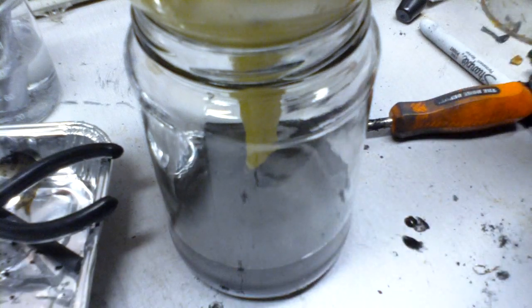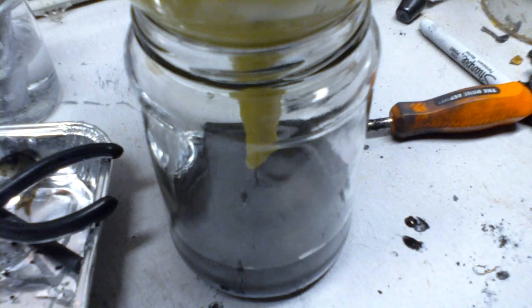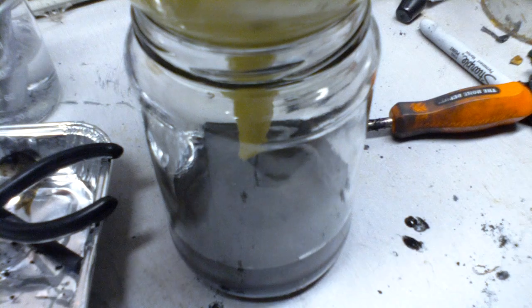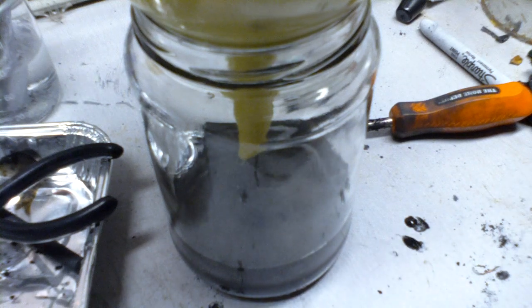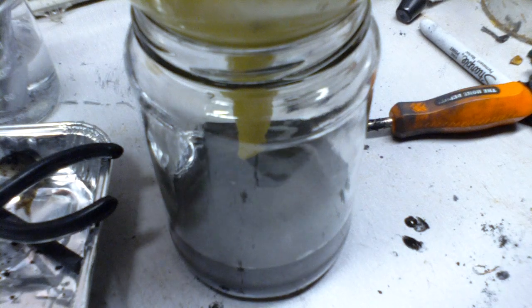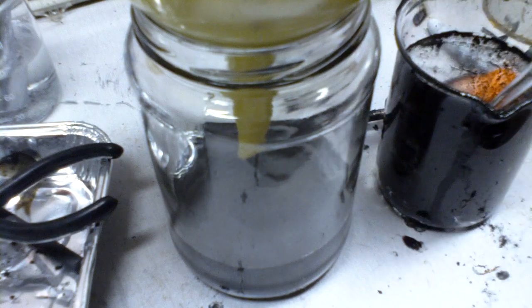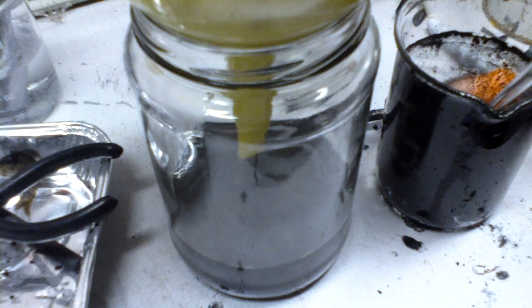Now once you have the paste, you can either heat it up on a hot plate to dry all the water out of it, or you can just let it evaporate, put it out in the sun. Either way works fine. And let that filter.